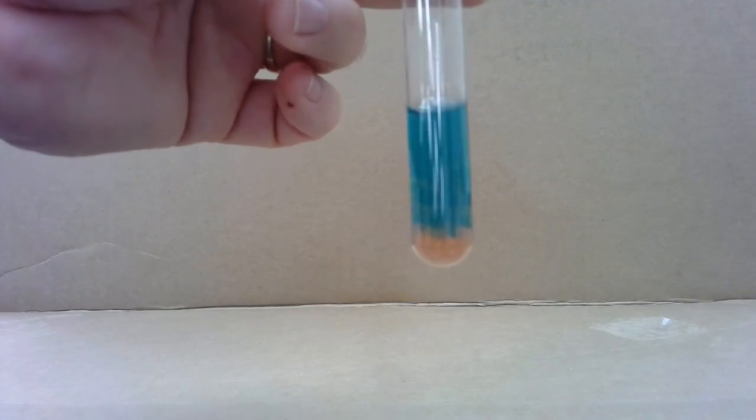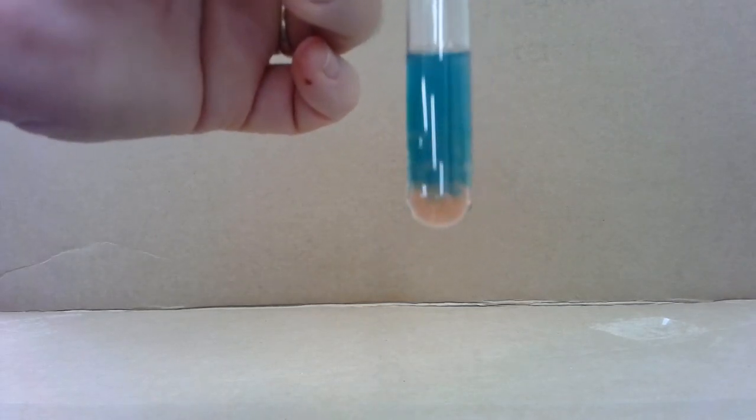So we got the color change again, which we could not have predicted. I mean, I could have predicted it. You could not have. And the formation of a solid or a precipitate has formed as well.